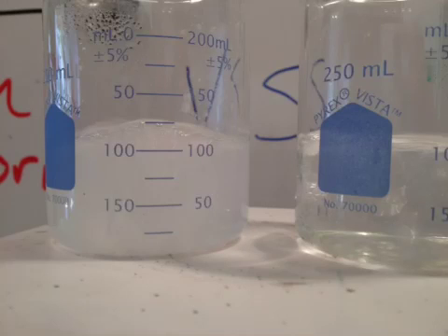This is an example of the different solutions. The one on the left is sodium chloride and the one on the right is magnesium sulfate, and you can see different things are happening in each one. Make sure you're recording your observations — what color changes happen, how much salt you're adding to each solution, how long it takes for things to dissolve. Every detail is extremely important for understanding what's happening in these solutions.